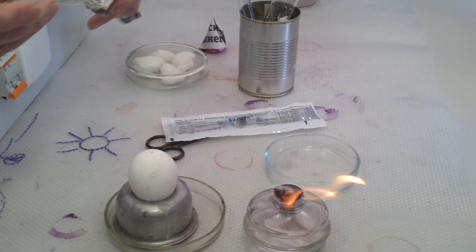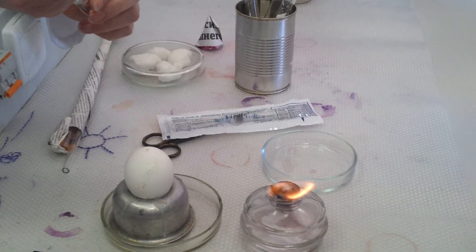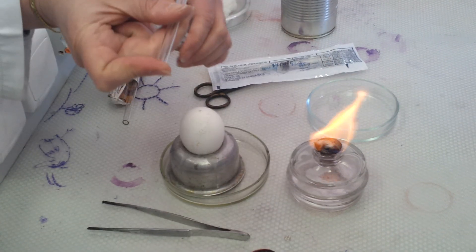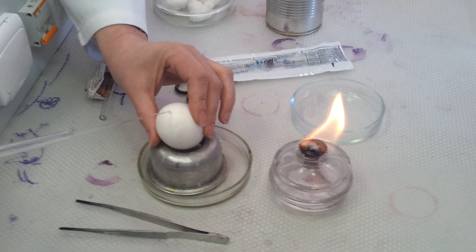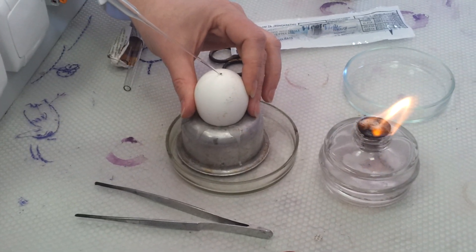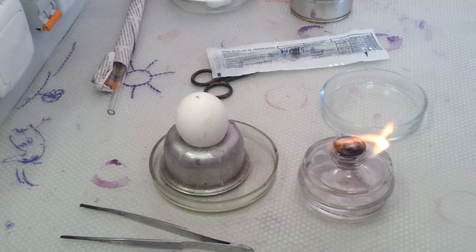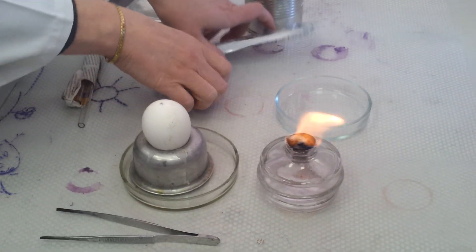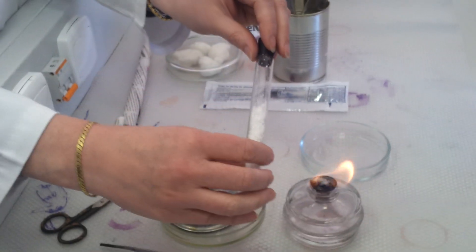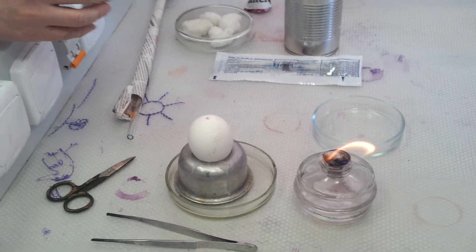I need to open it more wide. The virus-containing material is just put inside the chorioallantoic membrane. We open it, then it is covered with paraffin or parafilm, which is melted on the flame. Then it is put into the incubator for the necessary period.